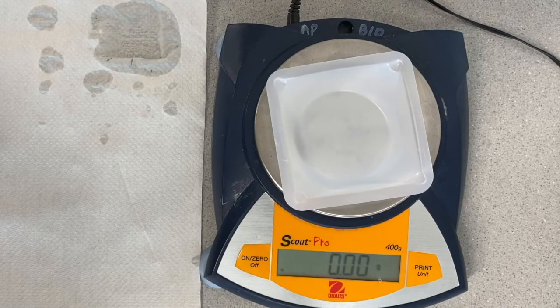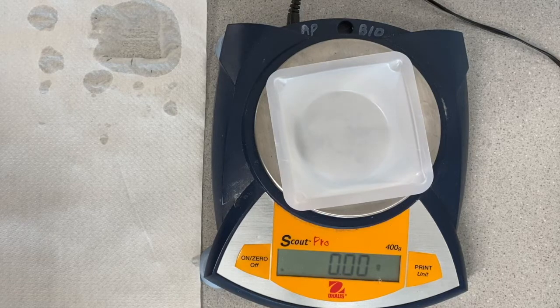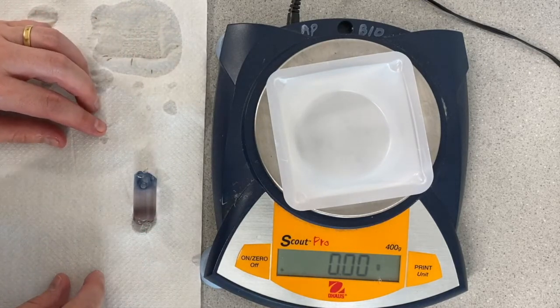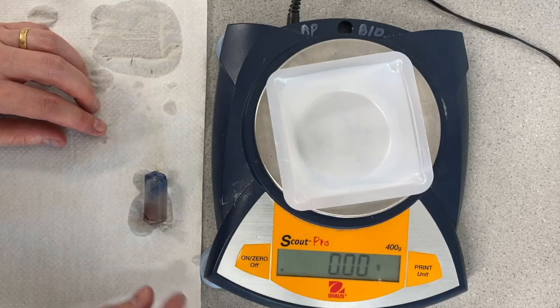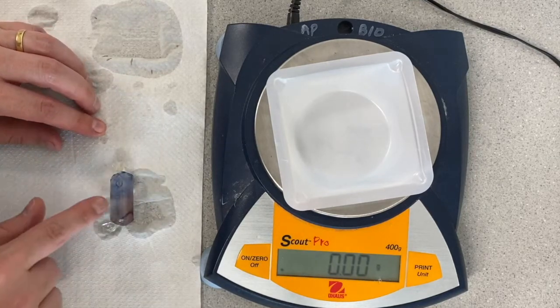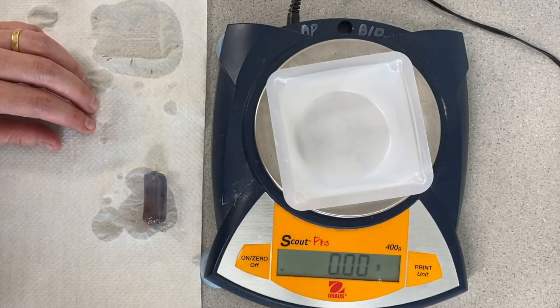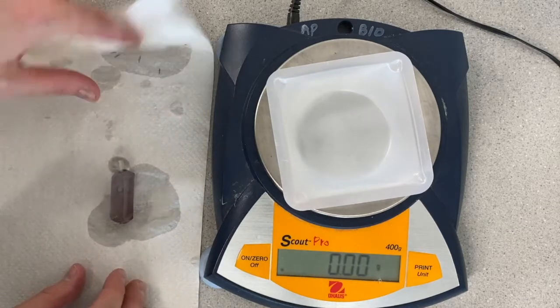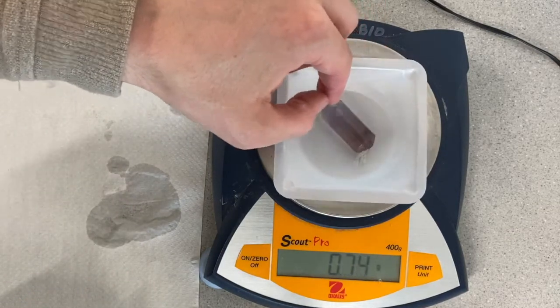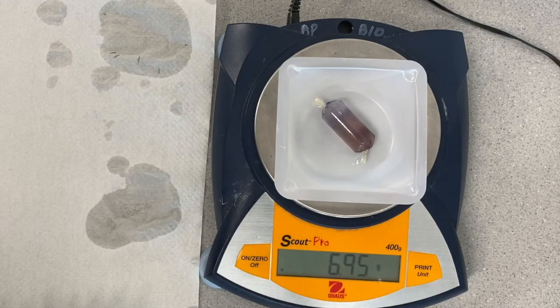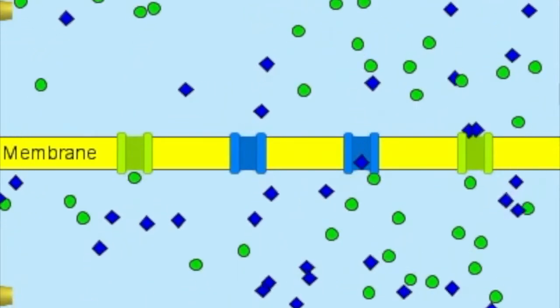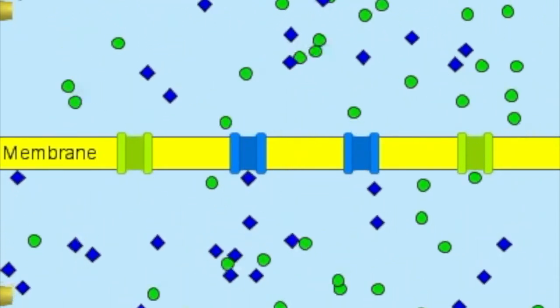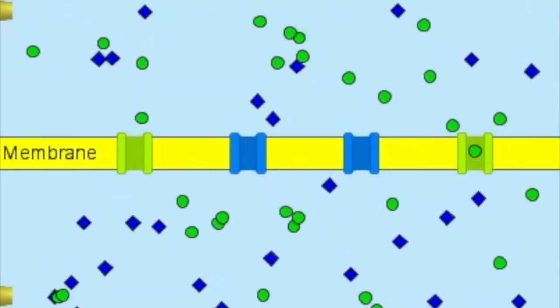Next, I'm going to take my starch cell. And with this one, remember, there's iodine on the outside of it. And this Lugol solution that is the iodine we're talking about is toxic if you ingest it. So I'm going to want to make sure that I wash my hands really good after this, and I'm definitely not going to want to eat anything until after I do. You can see really well now how kind of bluish purple my cell turned as a result of that indicator. And then I'm going to take one last mass reading of my starch cell, like so. And I compare this to the mass that I took at the beginning of this lab. So based on those observations and that data, now you should be able to draw some conclusions about which direction diffusion was occurring, if it was occurring at all, and what exactly was diffusing across this artificial membrane.